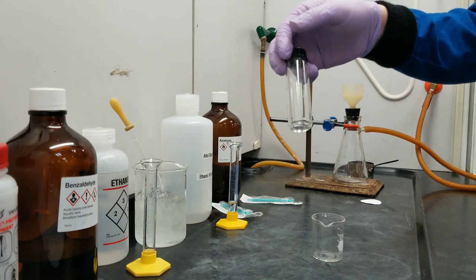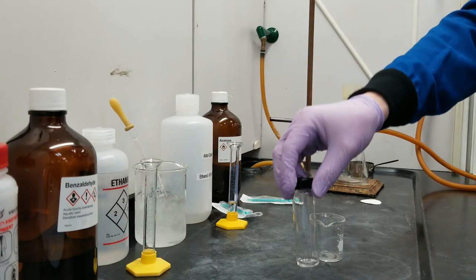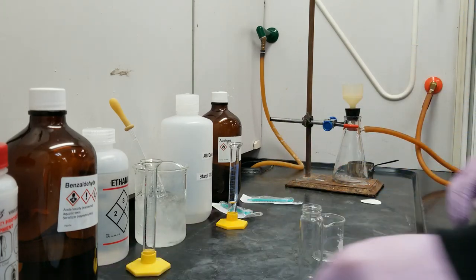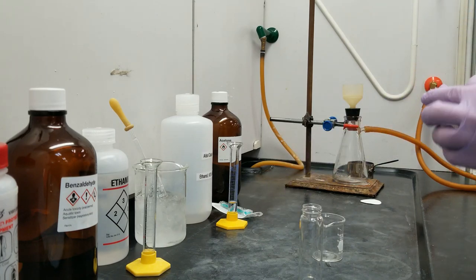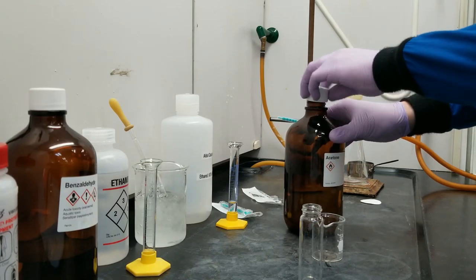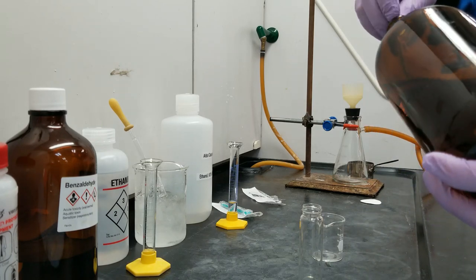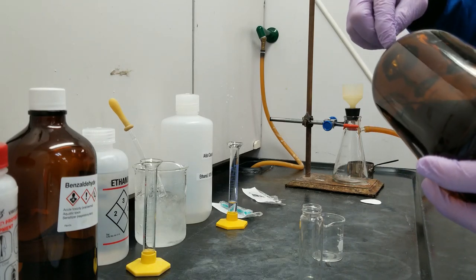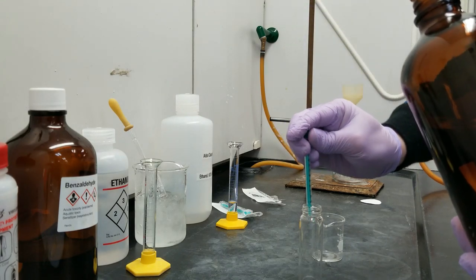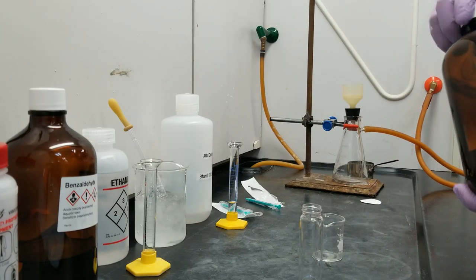In this 40 ml screw top vial, I have 0.75 ml of benzaldehyde. To this, I'm going to add 0.3 ml of acetone. I've got everything else pre-measured, but acetone is both volatile and it eats this type of plastic, so I'm going to move quickly. Acetone is in.